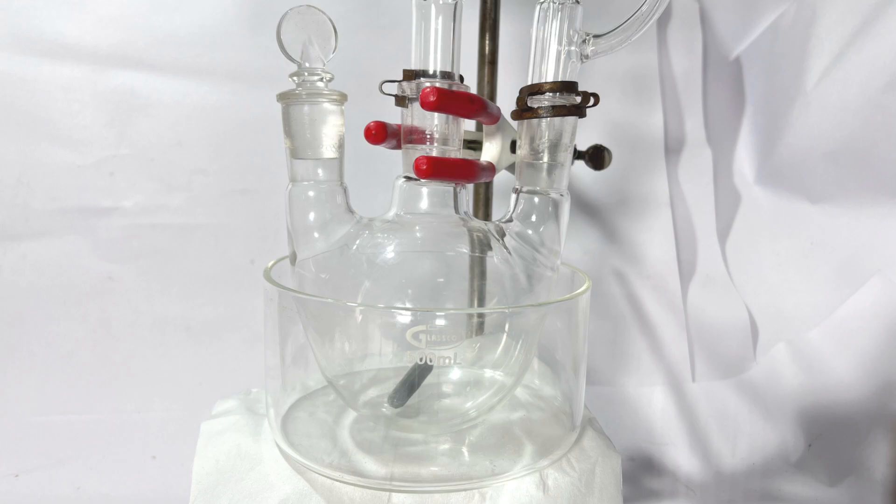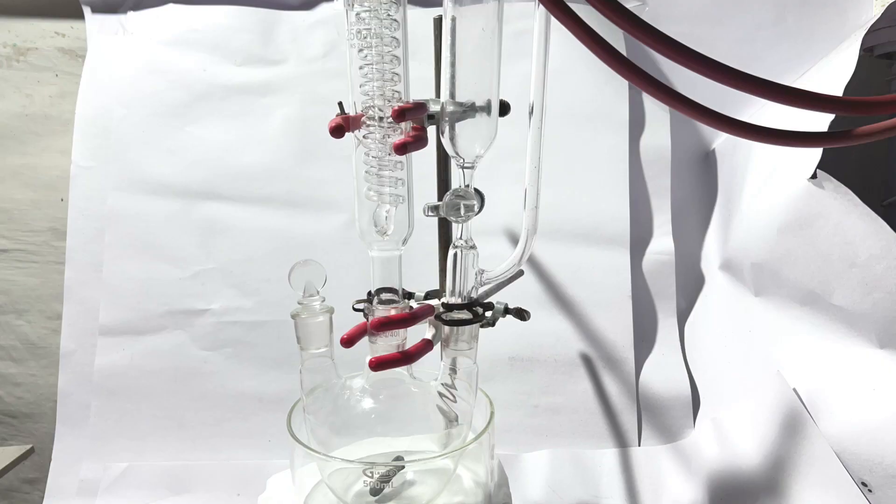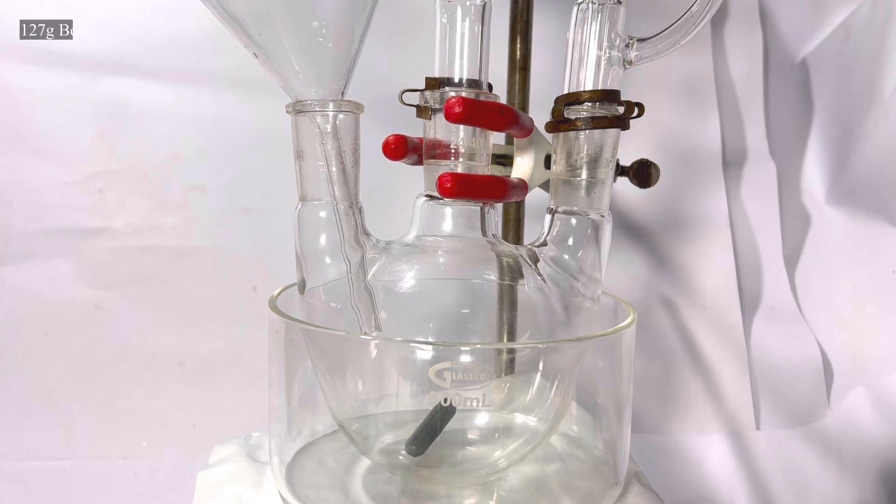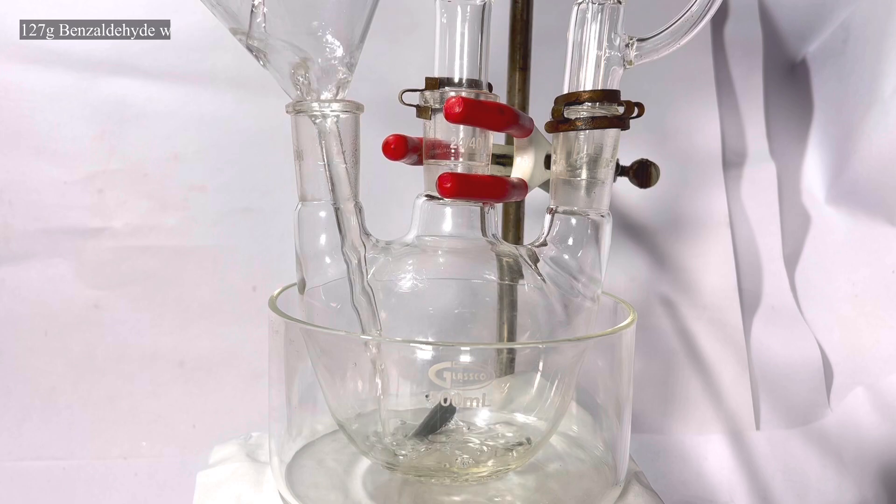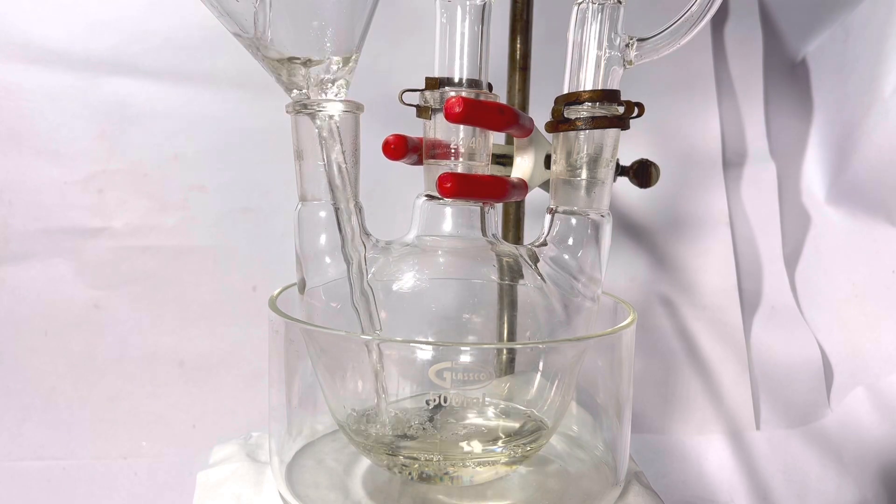The whole setup was placed in a crystallizing dish which will be later converted to an ice bath. 127 grams of freshly distilled benzaldehyde was added to the flask through one of the side necks using a glass funnel.